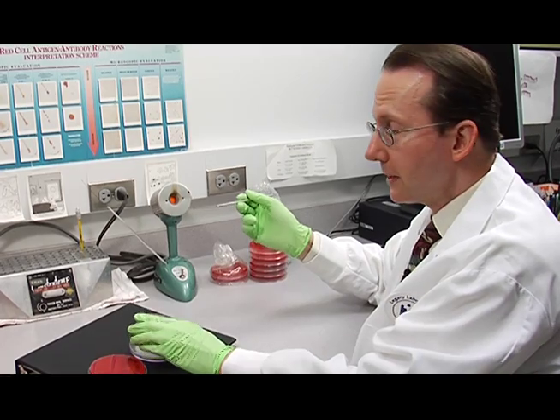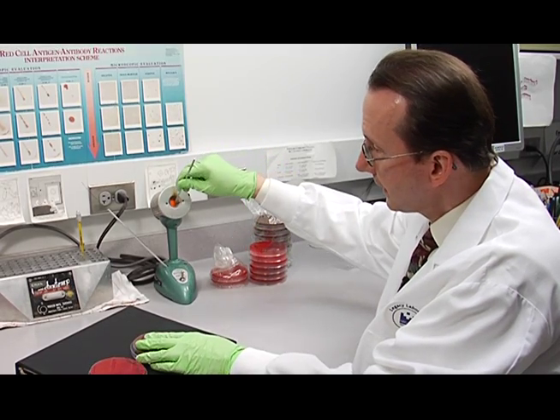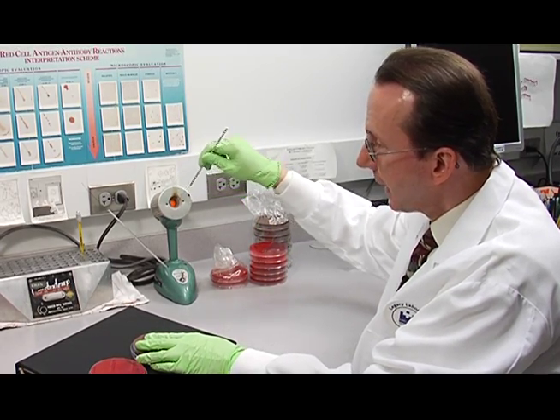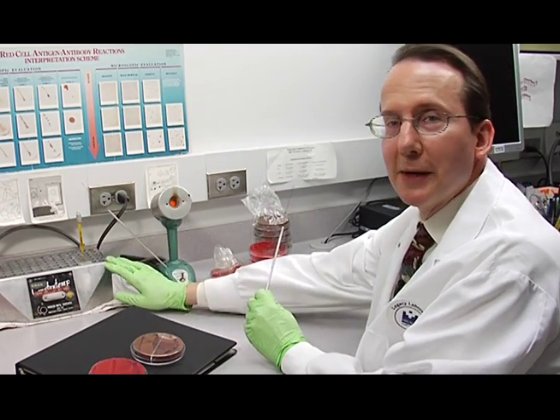So now I'm finished with setting up the female genital tract culture. The next step is to gram stain the smear.